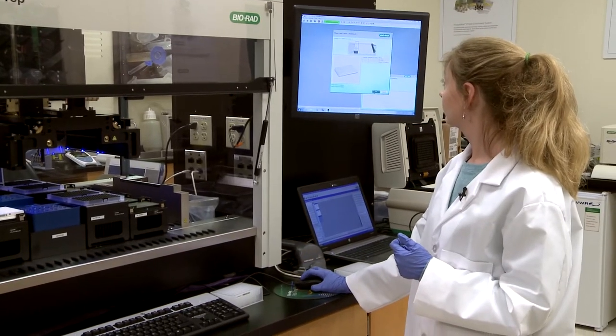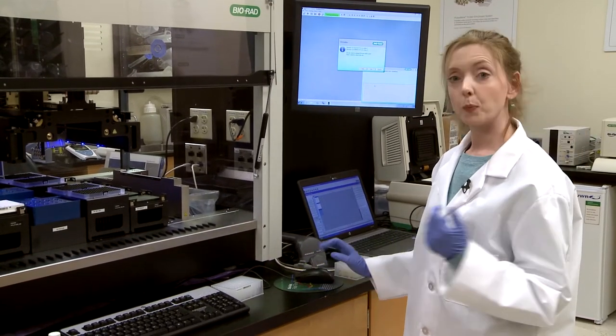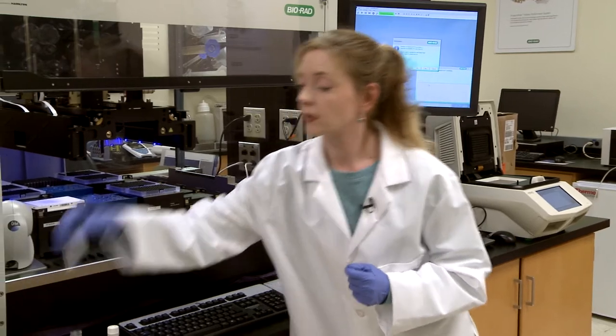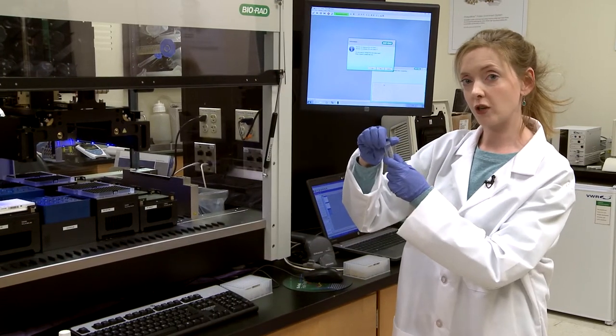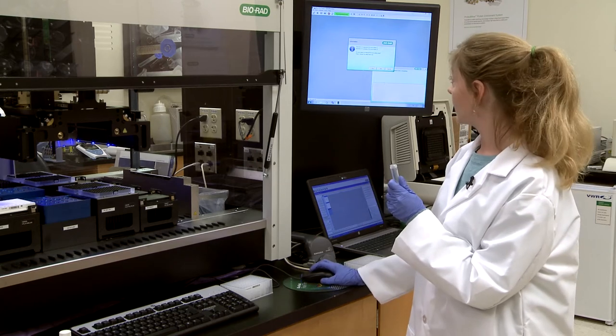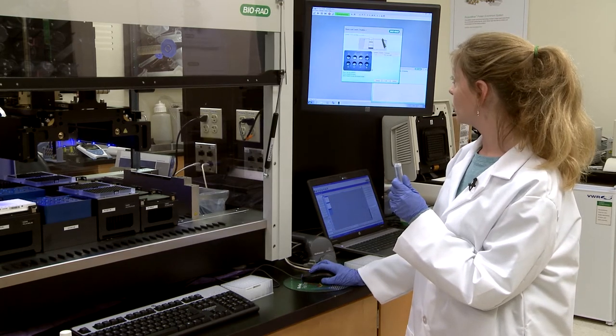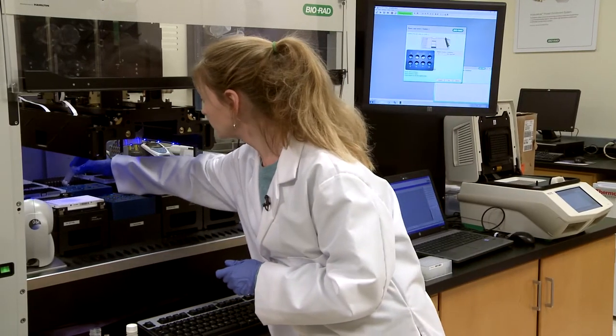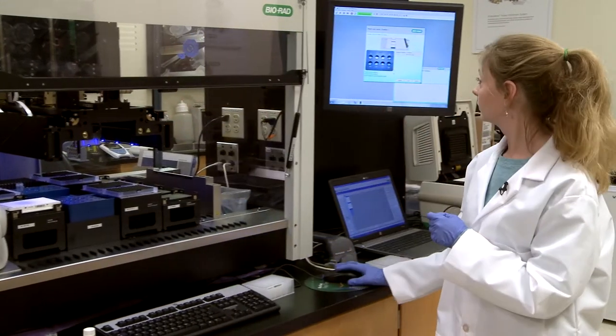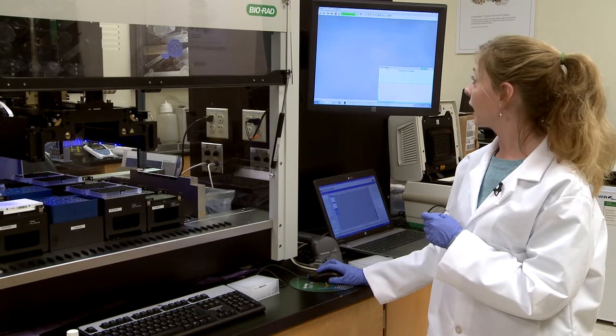The next thing is PCR mix tubes. So this is the empty tube where it's going to mix together the amplification and probe reagents. It's going to tell me I need to reload that tube into position one and click OK.